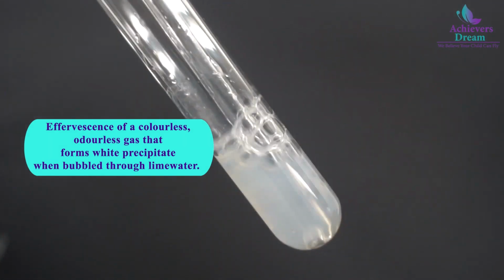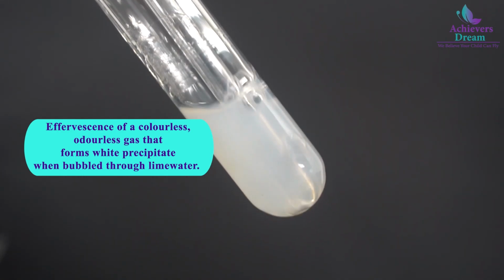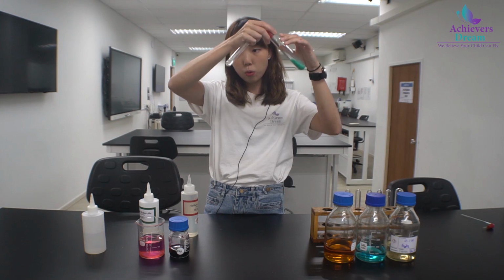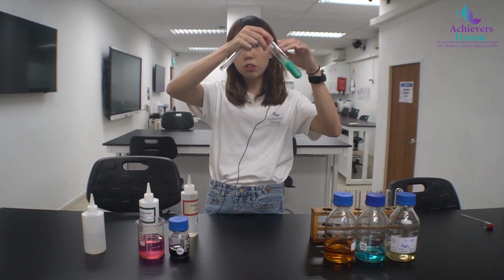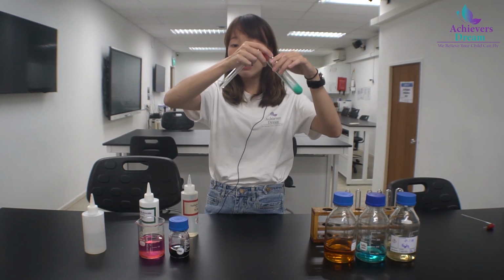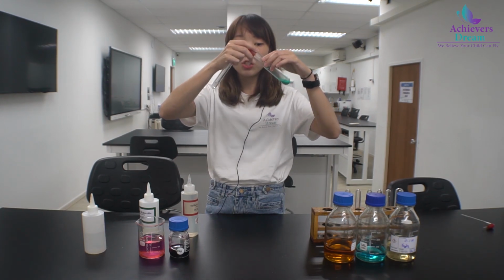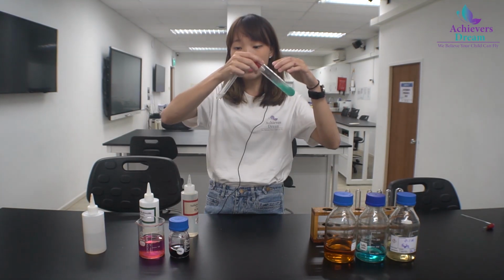Okay, just give it a shake for the reaction to occur. And after a while, you would see white precipitate form in your lime water. So this indicates a positive test. There is carbon dioxide evolved, which means there's carbonate anion present.